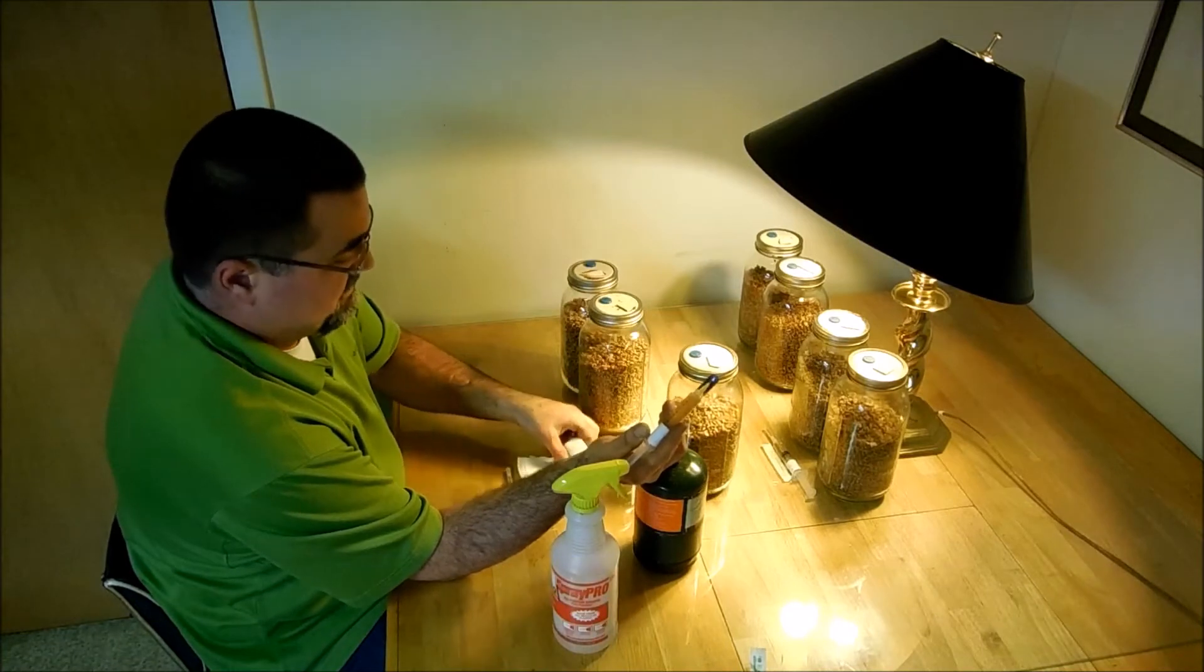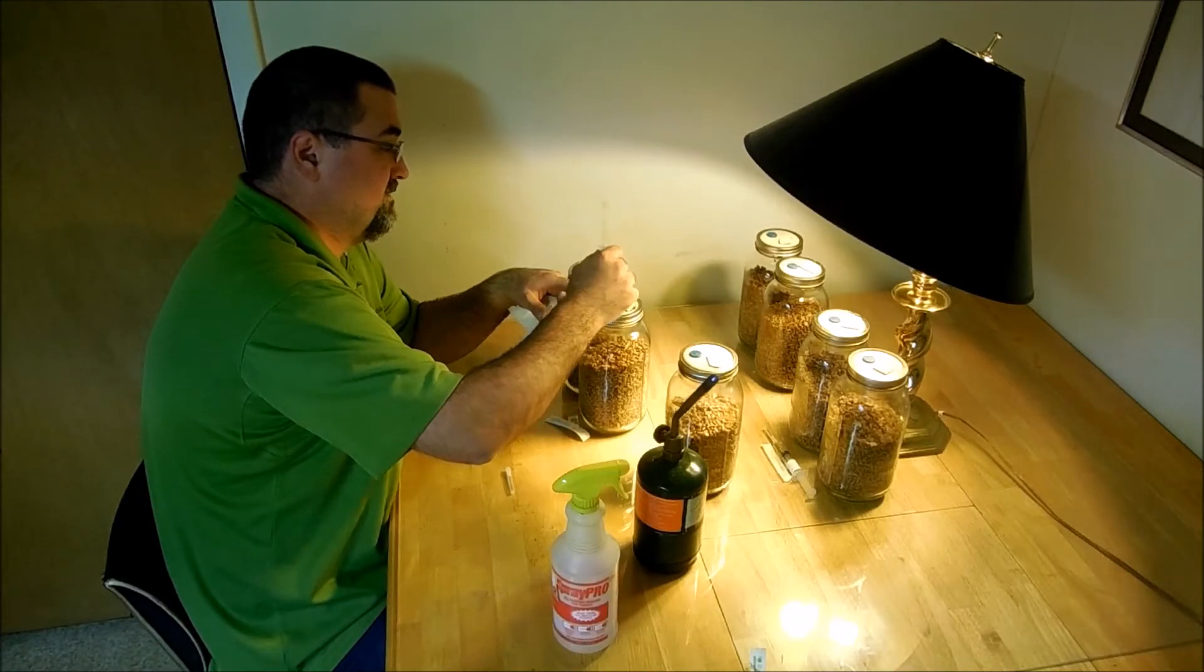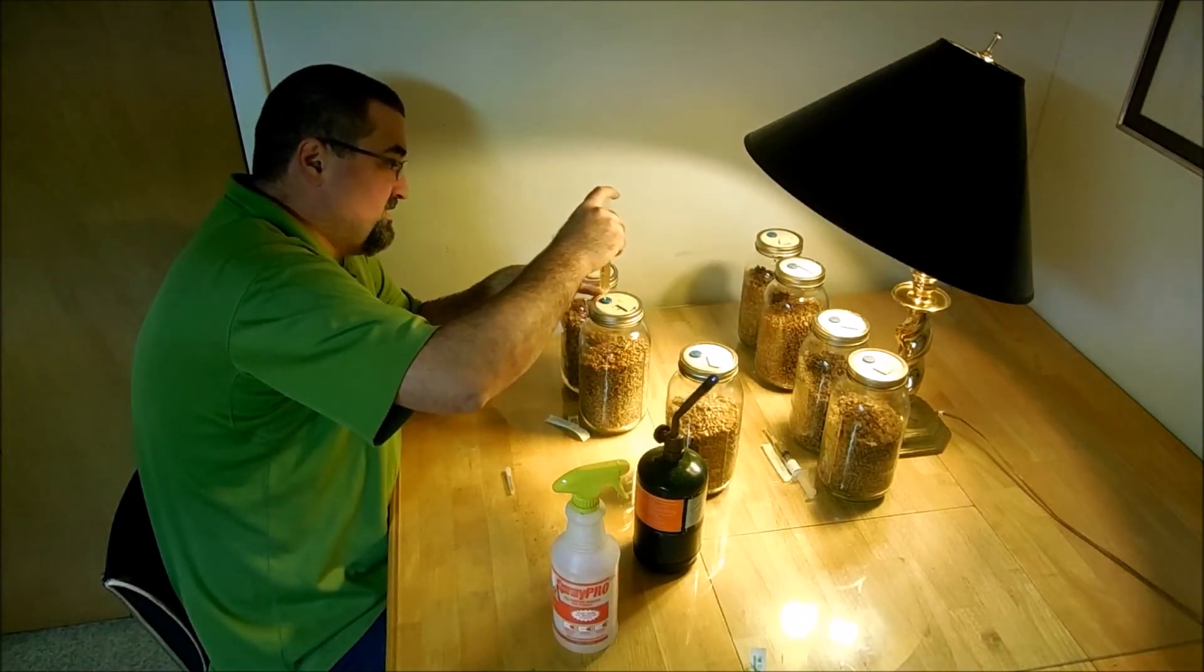I'm going to push this guy aside. Now the alcohol on here is just to cool the needle off so it doesn't damage my thing here. Put two more cc's in there.